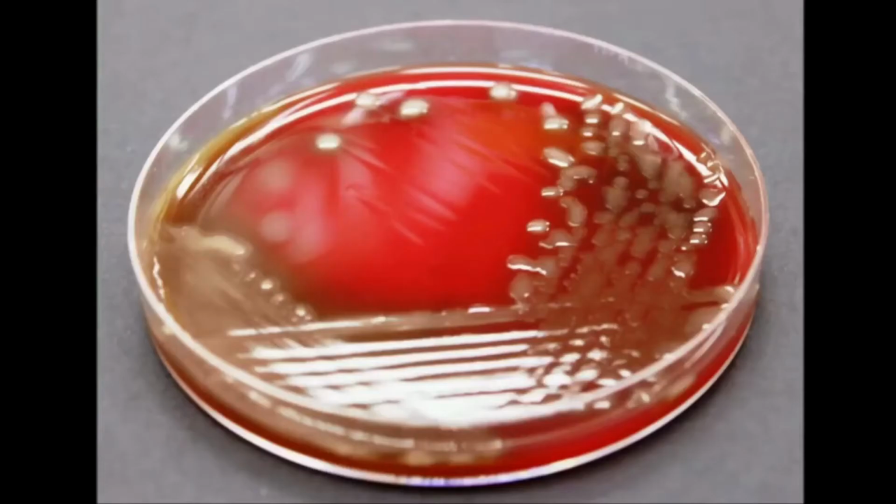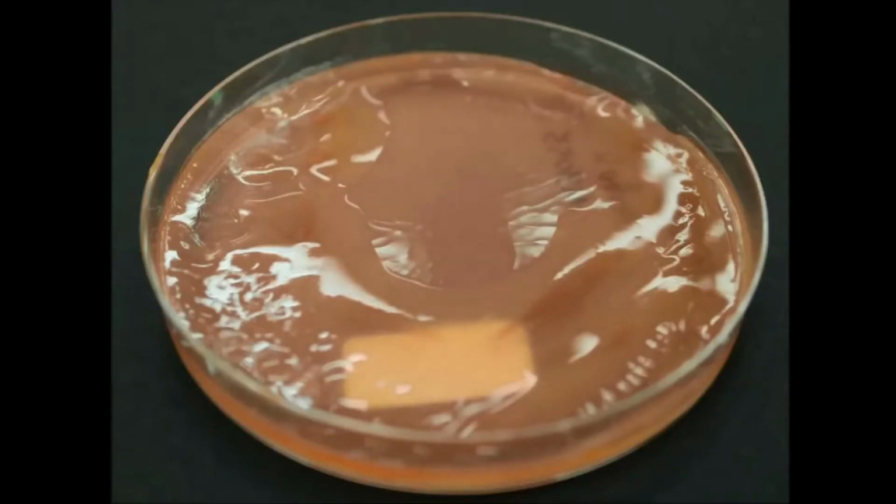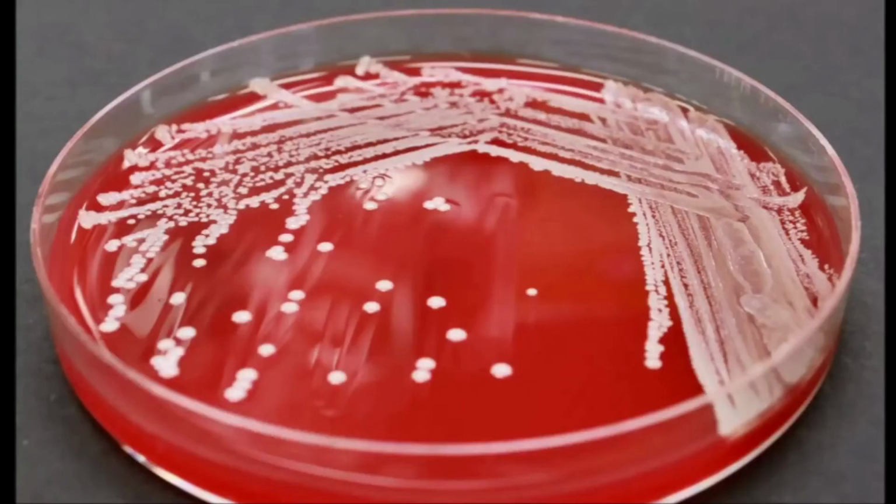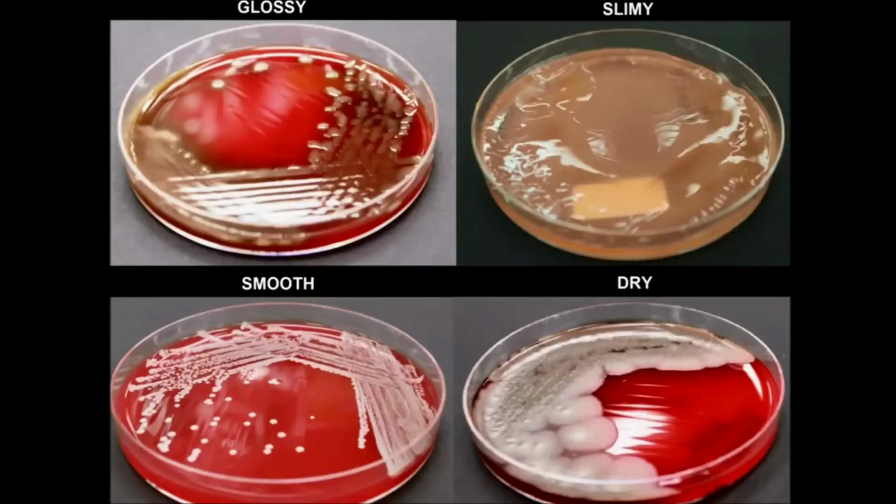Describing colony morphology is the first part of identifying and characterizing a bacterial culture, because individual bacterial species often form colonies of characteristic size and appearance. The four main characteristics we use to describe bacterial colonies are size, shape, colour, and any other distinguishing features, such as whether the colony surface is glossy, slimy, smooth, or dry.